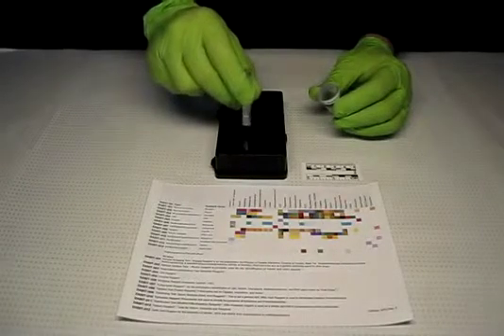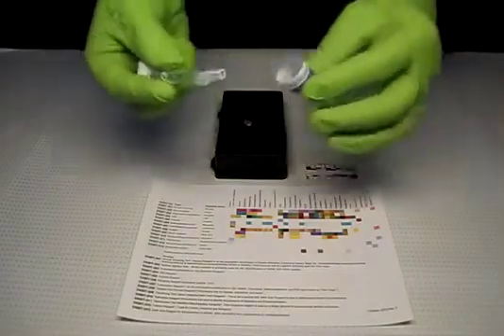Return the sampler to the clear tube sampler tip first and replace the cap.